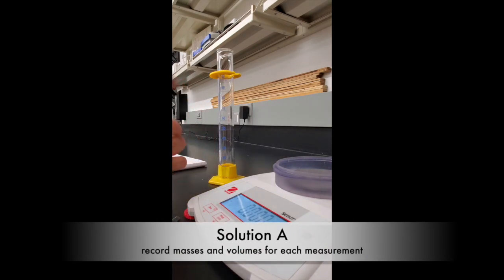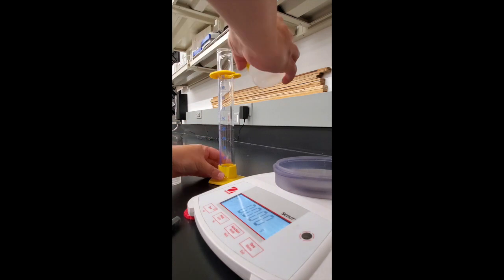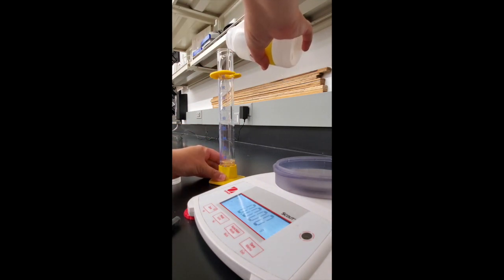In this experiment what we're doing is measuring different solutions, checking the volume, and then recording the mass.